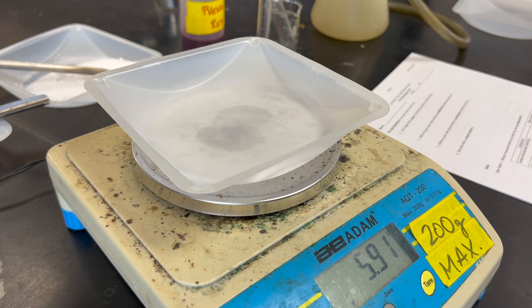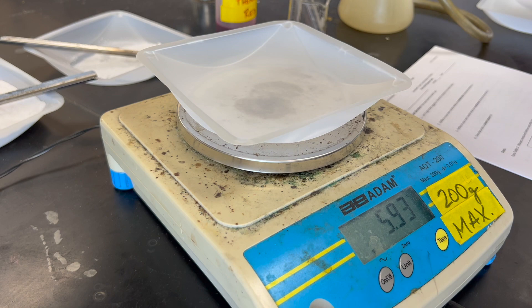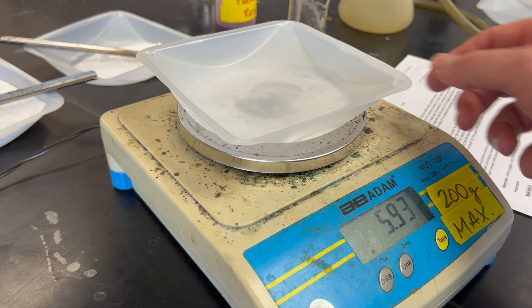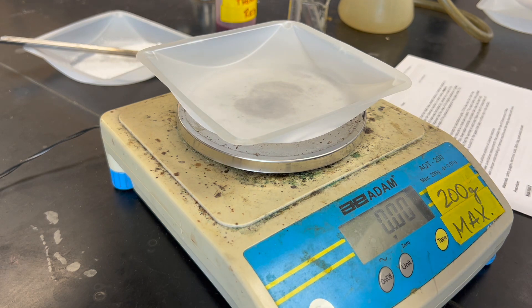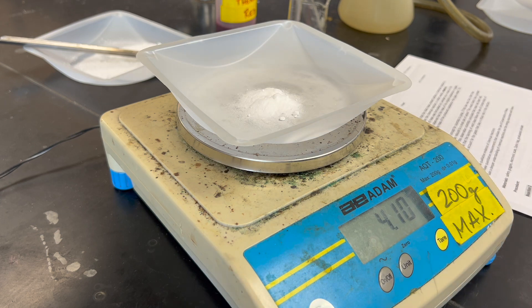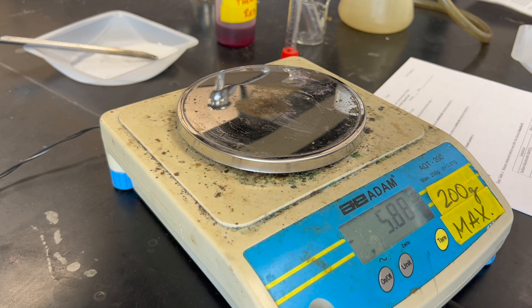The first thing we're going to do is perform the chemical reaction in the closed system — reaction number one — and we're going to follow the procedure here. We need to obtain approximately four grams of sodium bicarbonate and record that exact measurement. We're going to zero out the weighing boat and get approximately four grams of sodium bicarbonate: 4.08. We're going to note that in our data table.